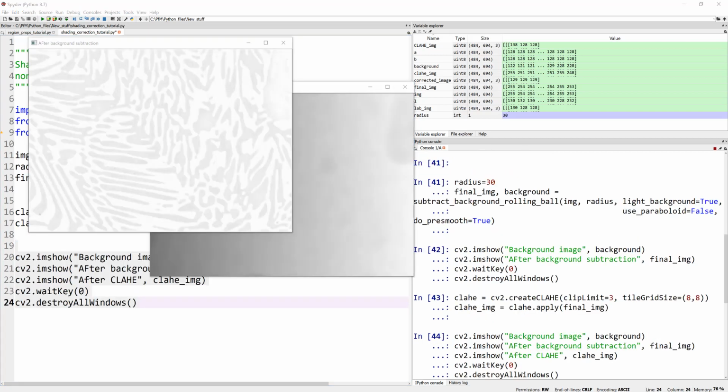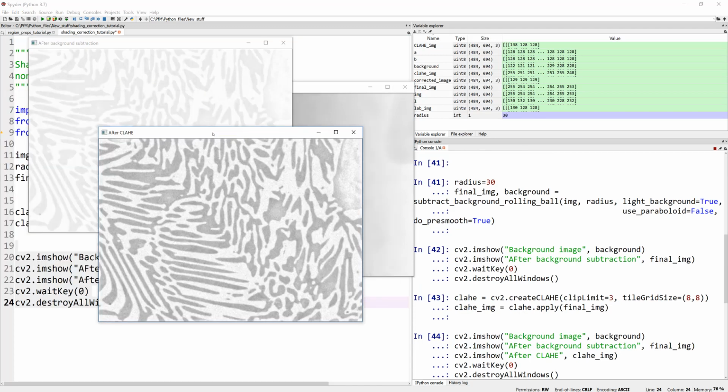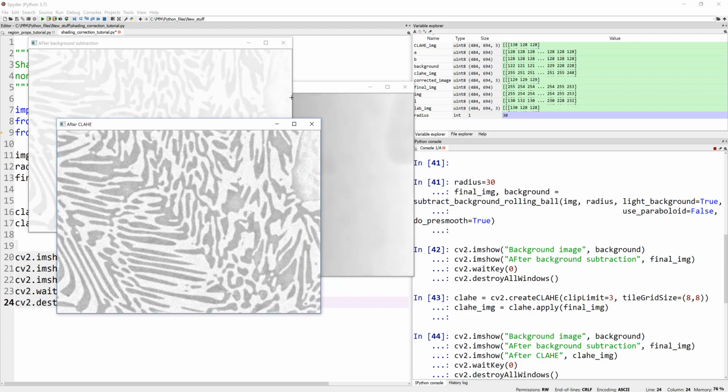There you go, and now we should see three images. The third image is on my other screen. In fact, that image looks great on my other screen, but I hope it shows up okay during my recording. Anyway, we started off with an original image that looked pretty non-uniformly illuminated, and now we ended up with an image that is a bit easier to segment.